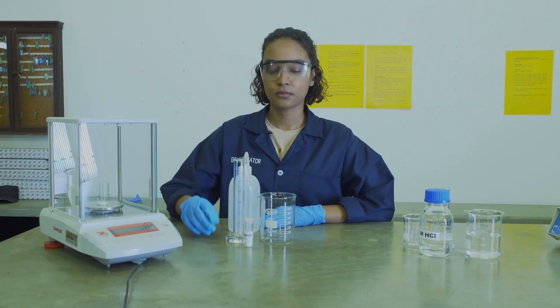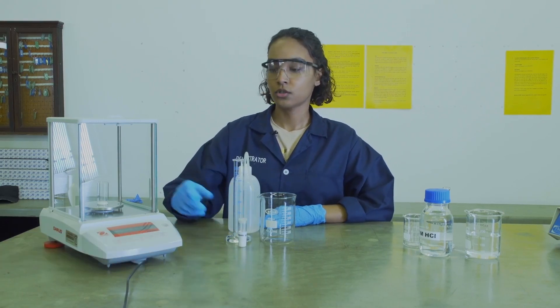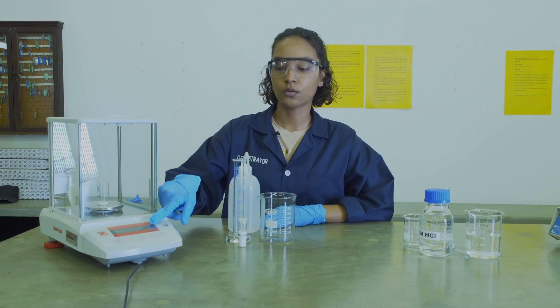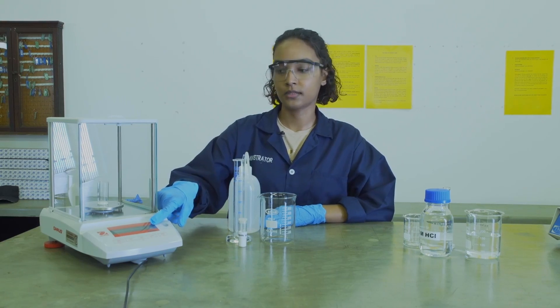In the beginning of this experiment, you need to accurately weigh 0.5 to 0.6 grams of your epsom salt, as shown in the weighing balance here, and record the value to four decimal places.